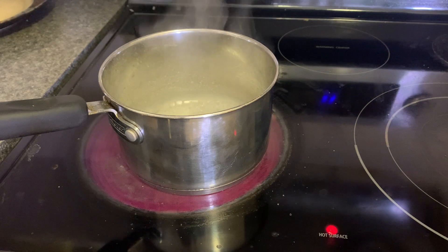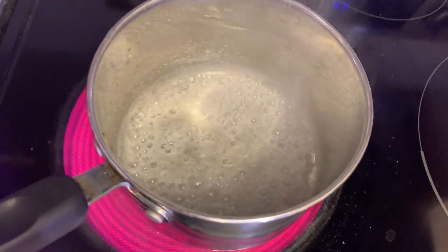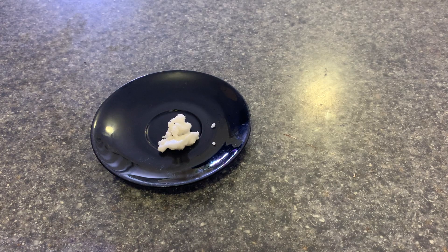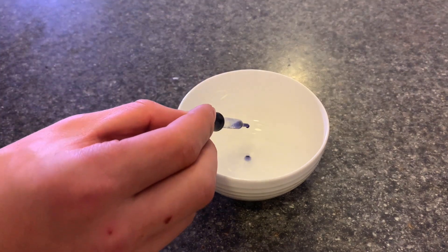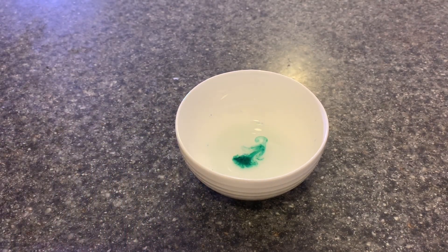Now as we are nearing the end of the boiling, meaning there's hardly any water left, we can look inside of this pot and see that most of the water has disappeared and that we are left with only a fine sludge of salt and sodium hydroxide. If we scrape the fine sludge off of the pot, we get this mixture which is mostly salt but has a bit of sodium hydroxide inside of it. Now if we mix a little of the resulting sodium hydroxide with water, we can test that it is in fact basic by pouring a bit of pH indicator inside of it. You see how it becomes green? That's an indication that the solution is basic, meaning that we did in fact get sodium hydroxide.